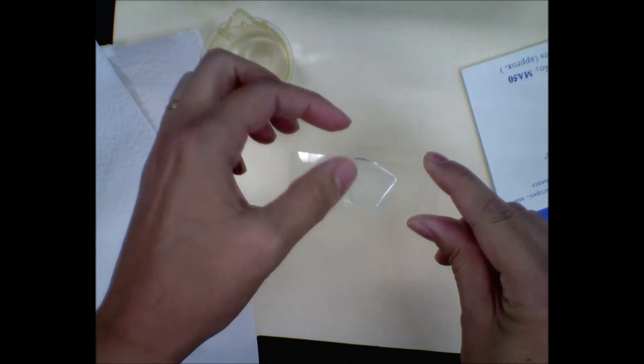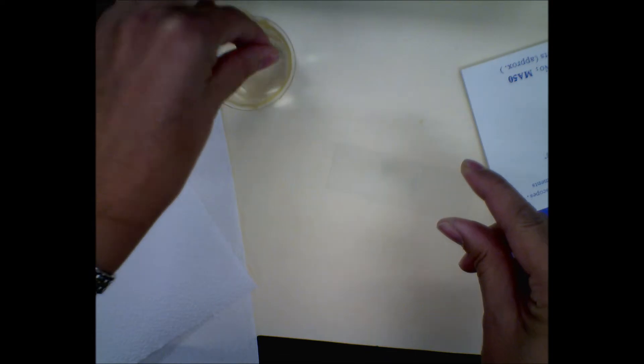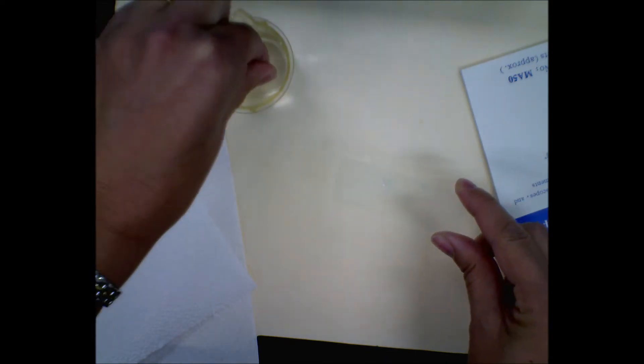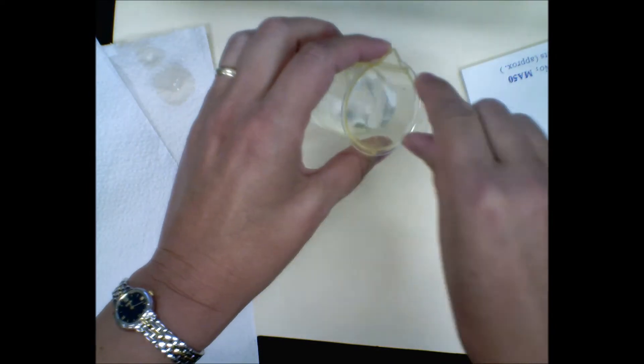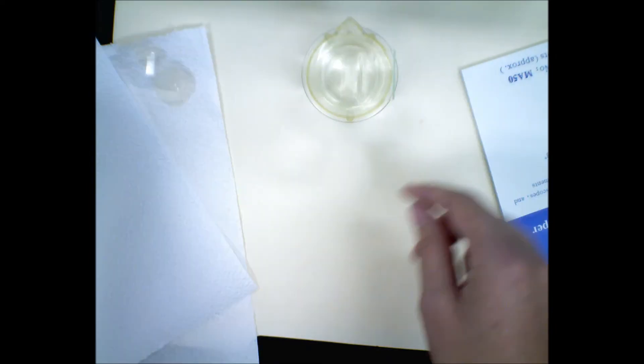Okay, so I slide the cover slip off, and I'm going to dip it into some clean water. It can be tap water. I'm going to lay it on a paper towel. I'm also going to put that into the clean water for the moment.